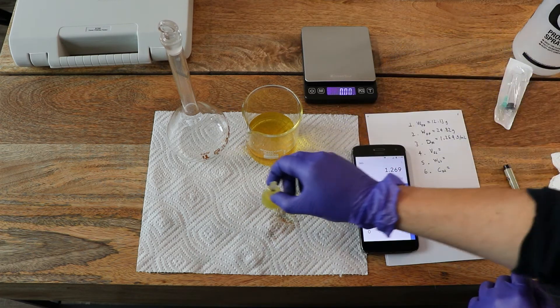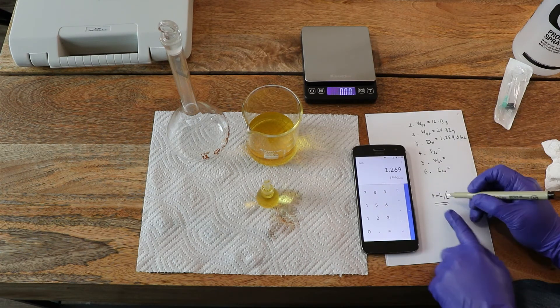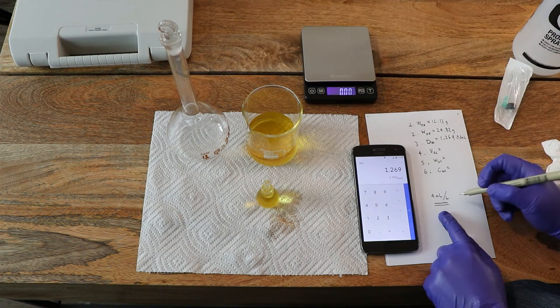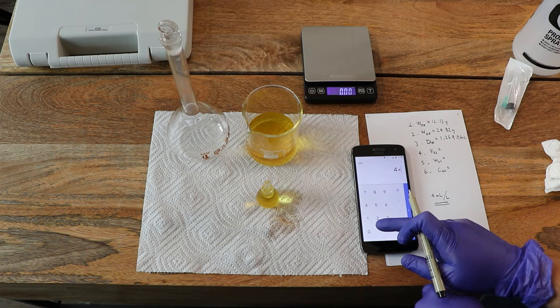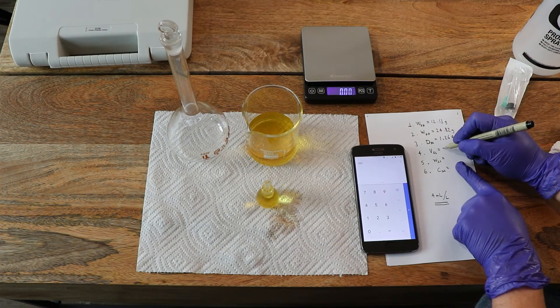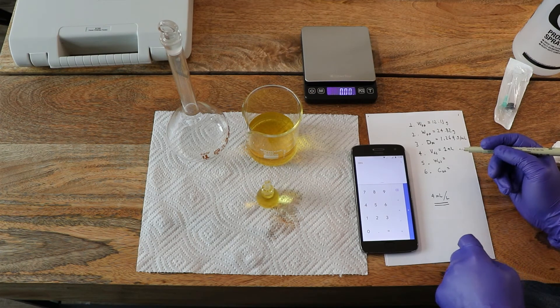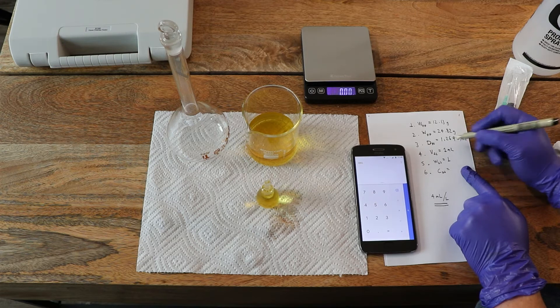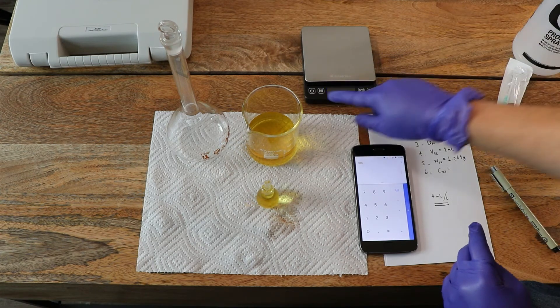Now we have finished the measurement of the density. What I want to calculate is the weight that I would need of the solution to match this dilution rate. The volume of stock solution needed for 250 milliliters — which is what we want to prepare — would be four divided by four, which is actually just one milliliter. Then I need to calculate the weight: since we know the density, it's one milliliter times 1.269 g/mL, which gives 1.269 grams. So this is what I need to weigh.